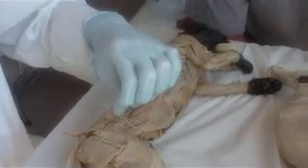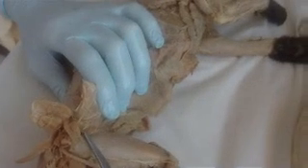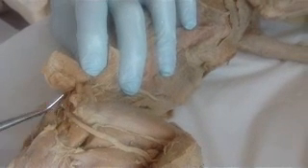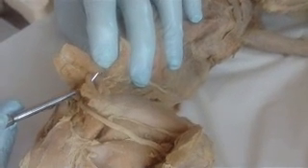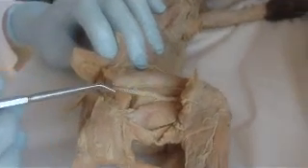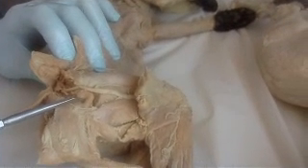This here is your tensor fascia latae — remember sartorius and tensor fascia latae from before; that's why it's important to know all of these muscles because you see them here too. Gluteus medius. Since we're on the opposite side of the cat, the top of the thigh is now on the other end. This is my vastus lateralis — I follow it down and hit my gluteus minimus. The muscle sitting above it is gemella superioris — it's attached to the hip bone. Moving it to the side reveals piriformis, the sciatic nerve, obturator internus, and quadratus femoris.